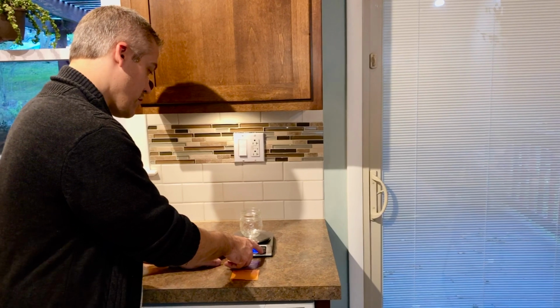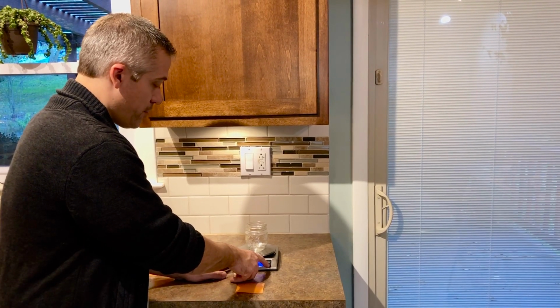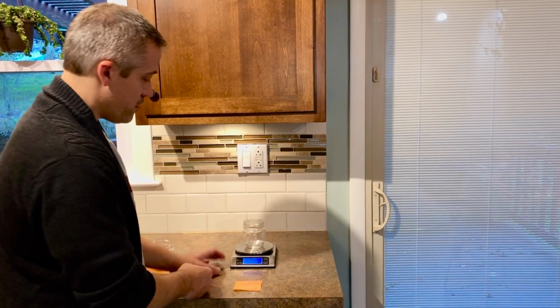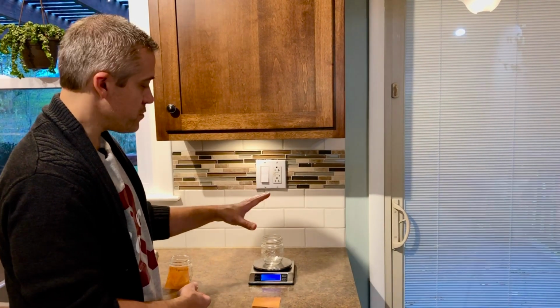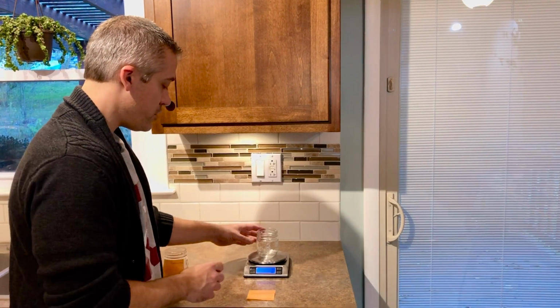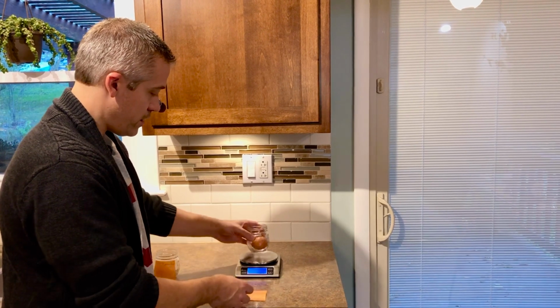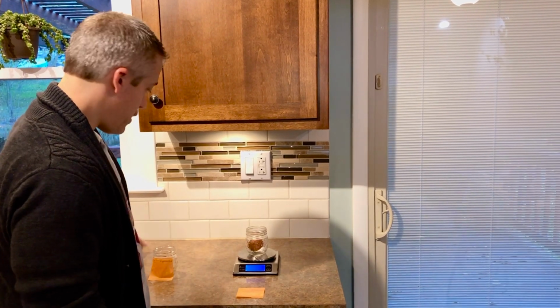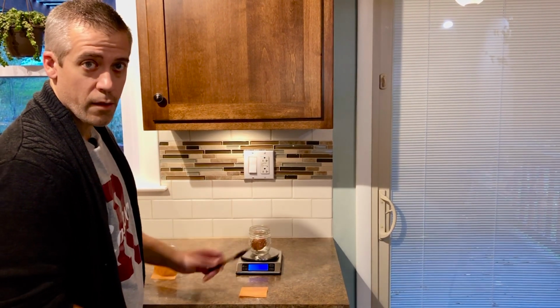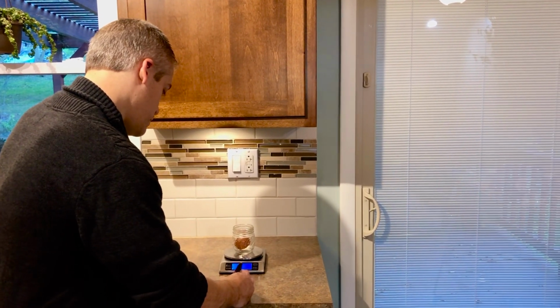So this button right here, if you do happen to have a scale, is called tare. If we hit that button, it brings it to 0. So basically the scale is not counting the weight, the mass of that glass container. So now I can put the egg in it, Eggwardo. And it goes gently, hopefully, and now it's recording a mass, a weight of 59 grams. So I'm going to write that down.